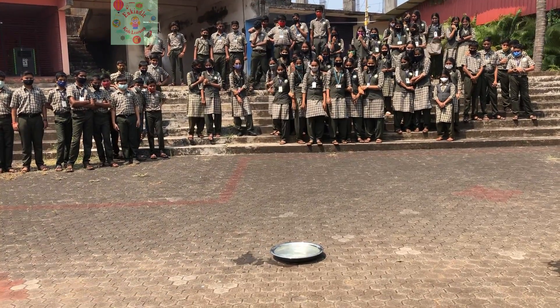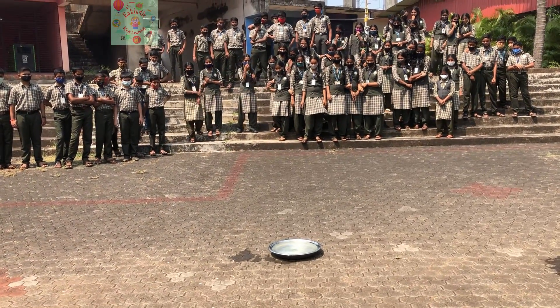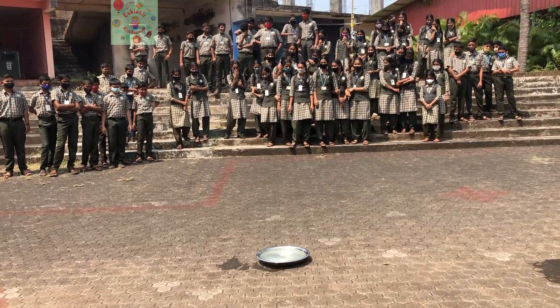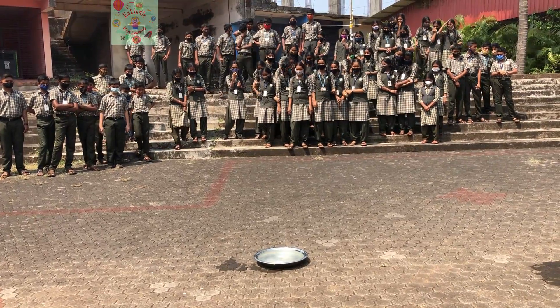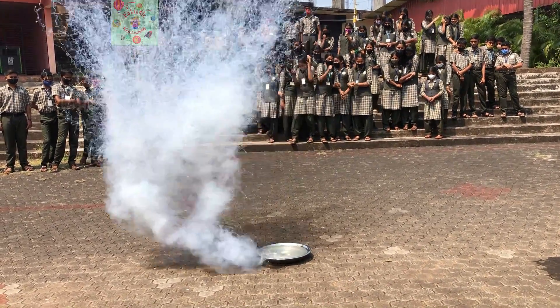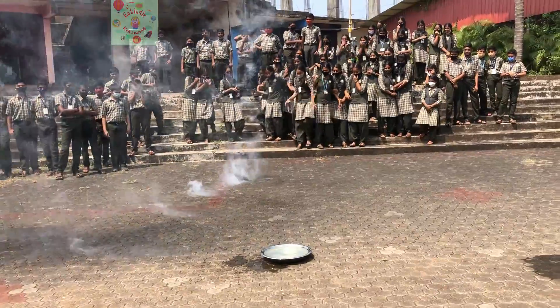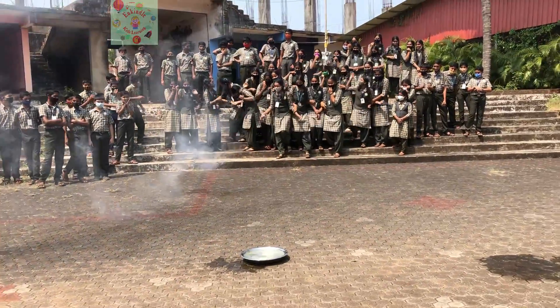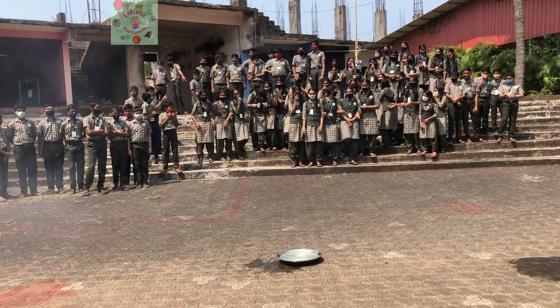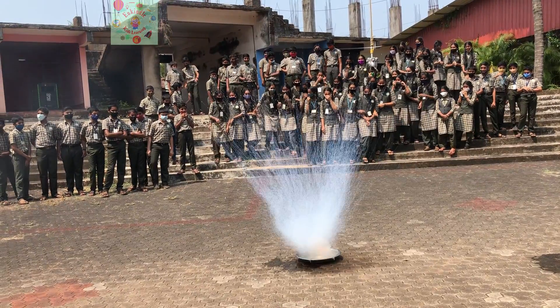The sodium may ignite and burn with a characteristic orange flame. The hydrogen gas released during the burning process reacts strongly with oxygen in the air.